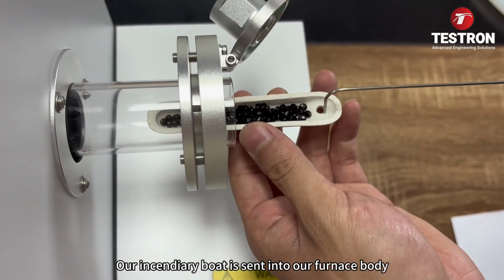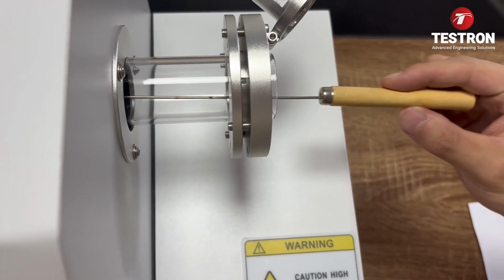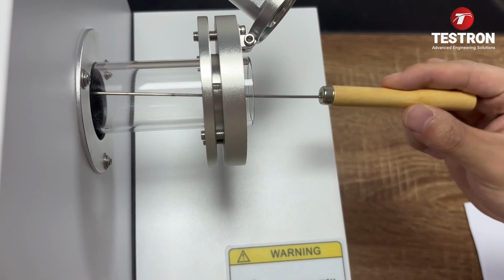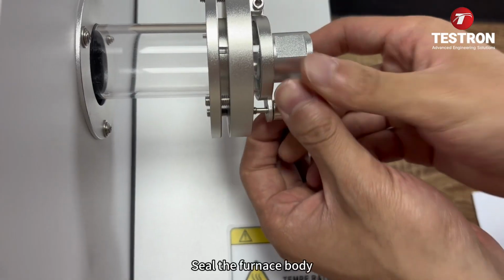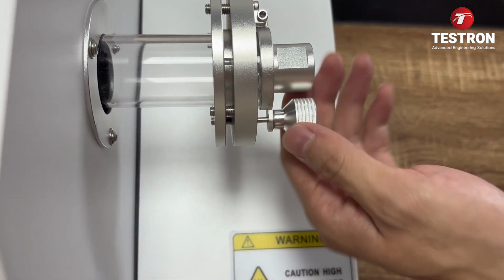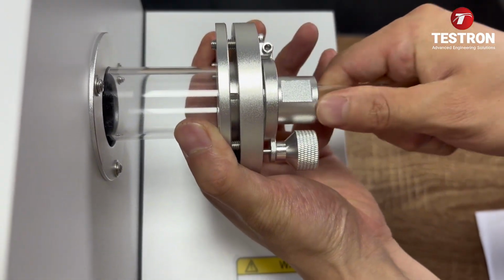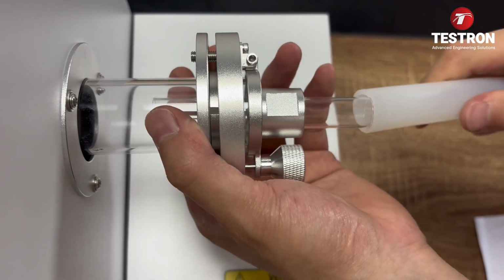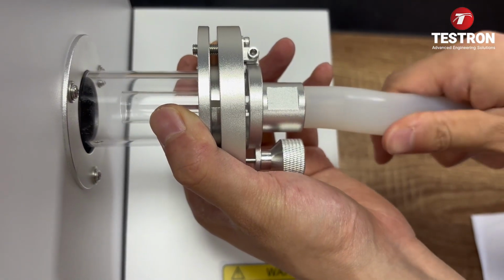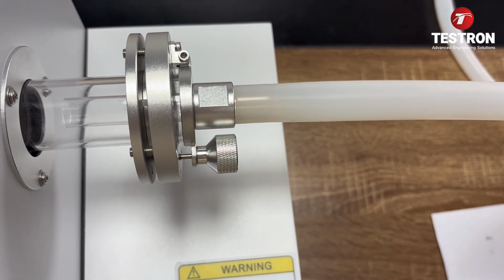First of all, our burning boat is sent into our furnace body. Seal the furnace body. Install the exhaust gas treatment device. This end can be discharged outdoors normally. Gas treatment of exhaust gas.